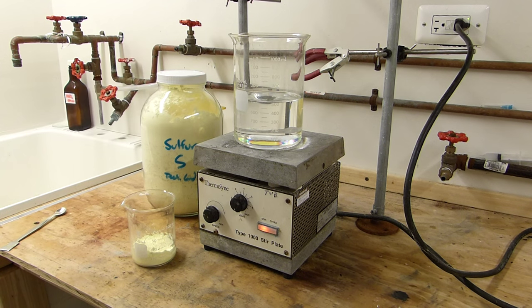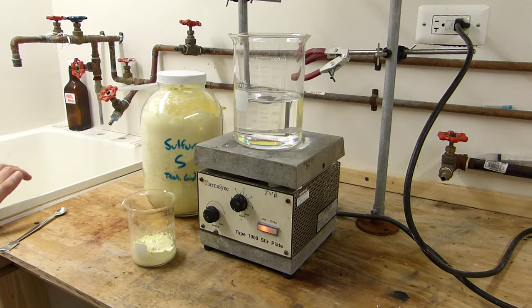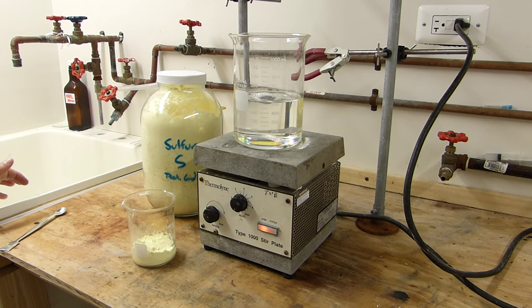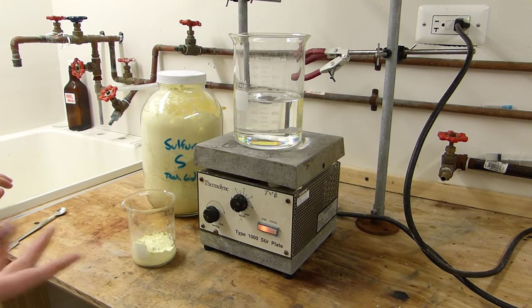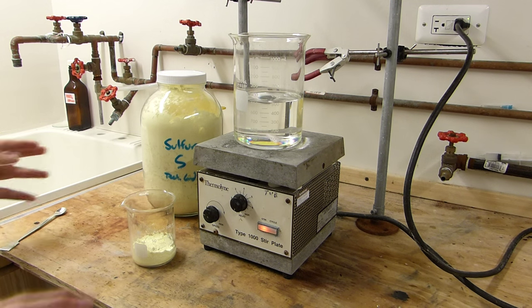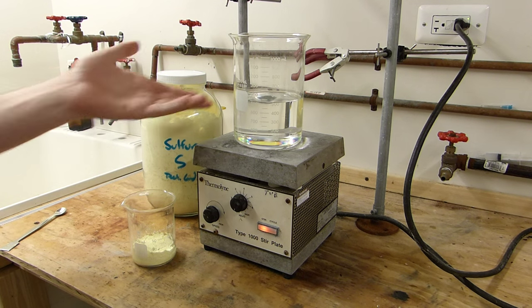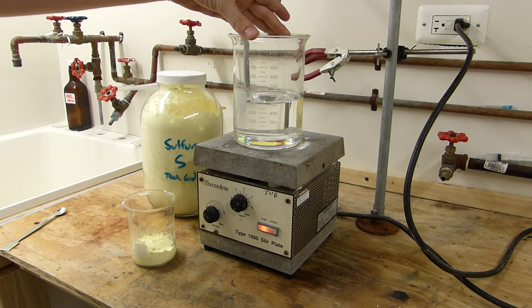If this were to catch on fire, there would be a lab disaster beyond belief in this room. So make sure you have a good CO2 fire extinguisher available, not water, or any sort of fire suppression system. The dry chemical works well, a bucket of sand can't hurt. Be very, very careful because half a liter of boiling xylene is no joke.